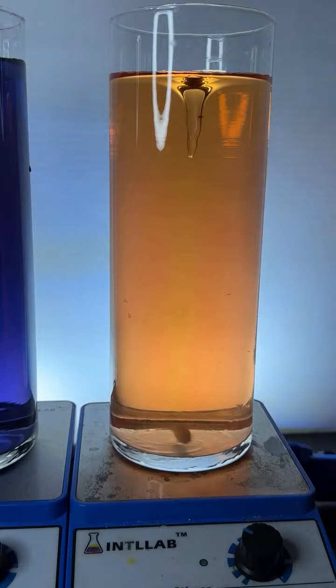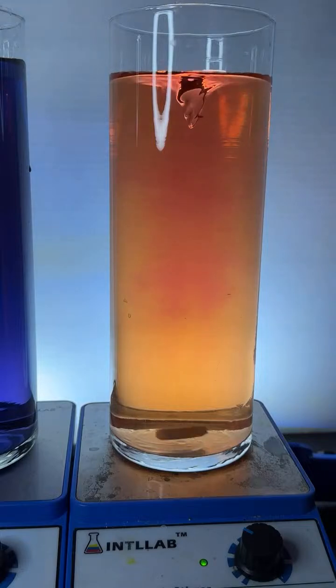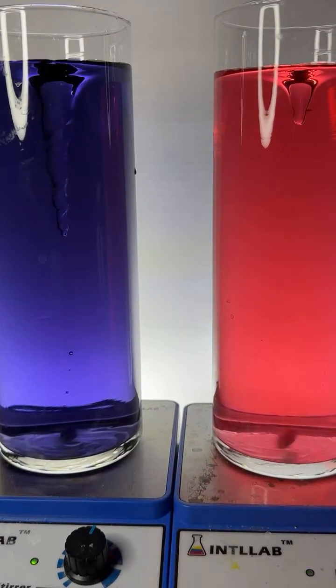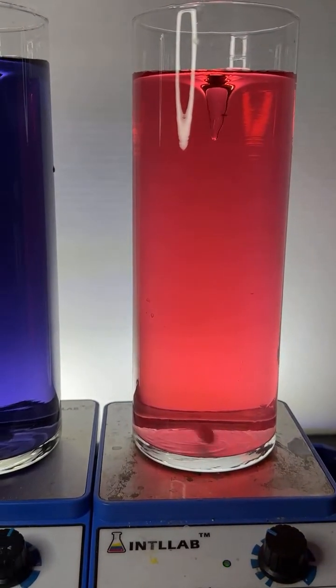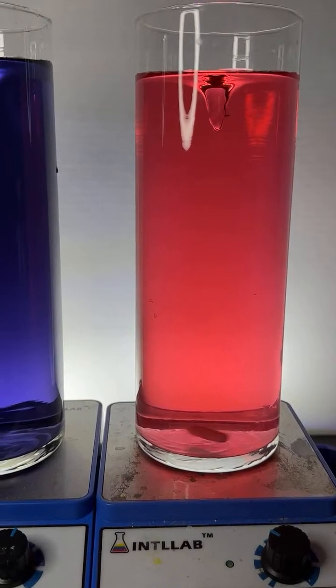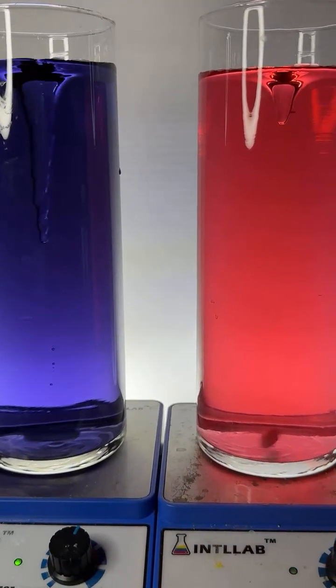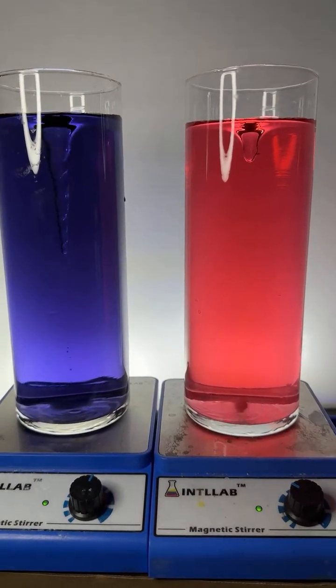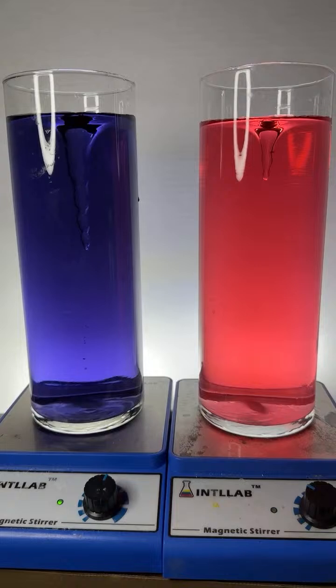Hello there, Jim Bros. What's going on? Somebody asked, let's mix them. So what I'm going to do is try to get this one over here at a pretty low pH, and then we've got this one over here at a pretty high pH, and we're going to mix them. Yeah, that's right, Pablo. The higher the concentration of the acid or base, the more it's going to burn you. Yep, Terminator, you got it. Well, we're just doing some experiments there, Jim Bros, as usual.